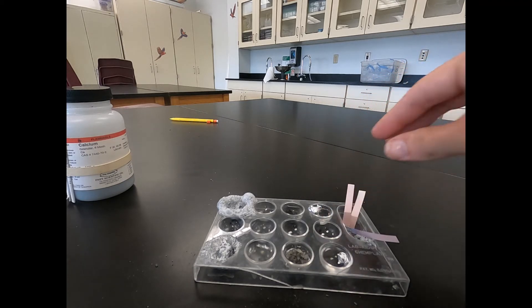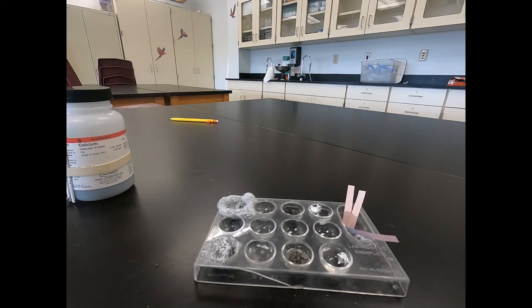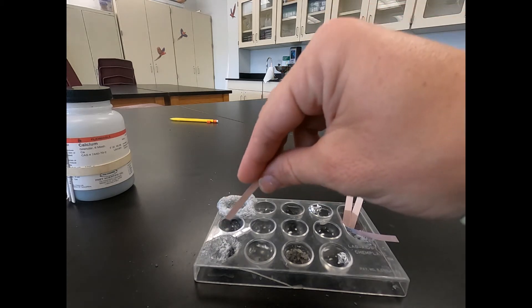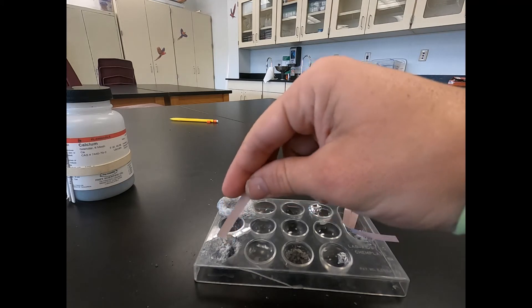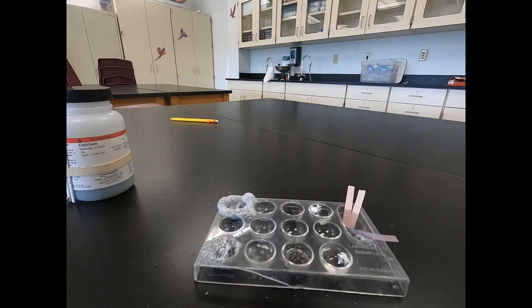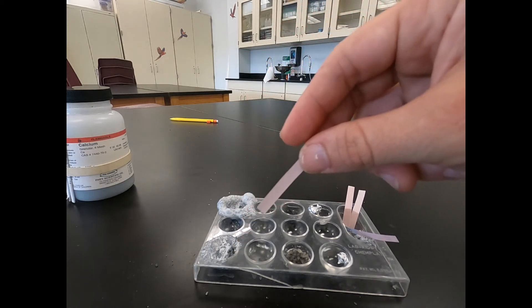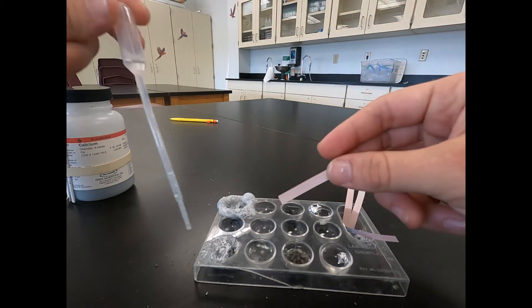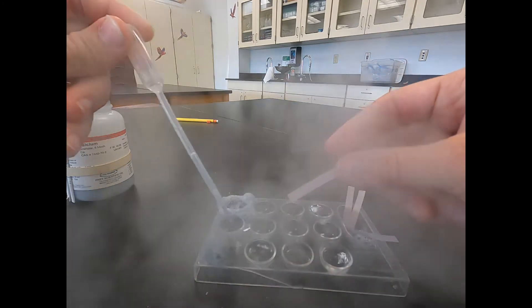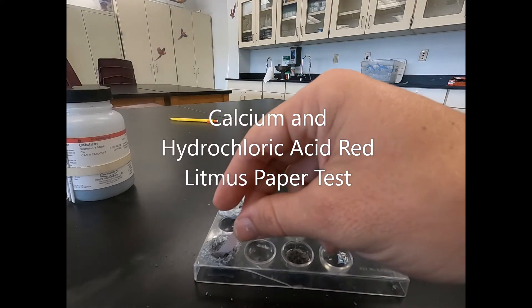So our last two stayed the same color. Next, we'll move on to our hydrochloric acid. With calcium, I have to add a little more of the hydrochloric acid just because I don't have any liquid left in there, so I'm going to add a little more of the acid. And then we'll dip it in.